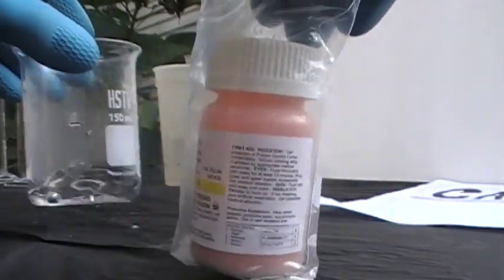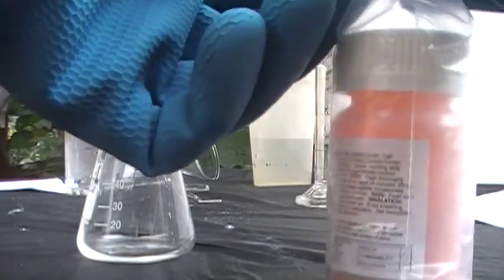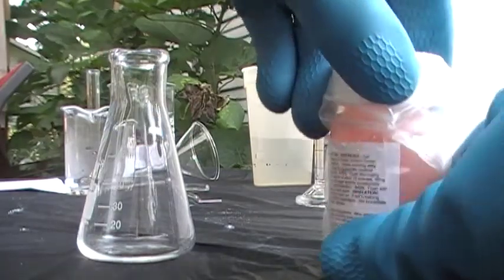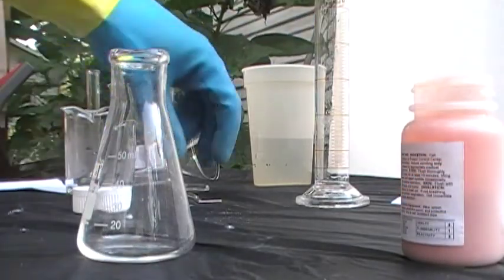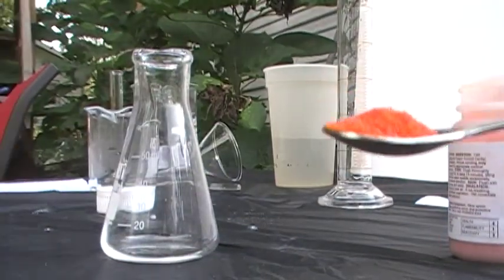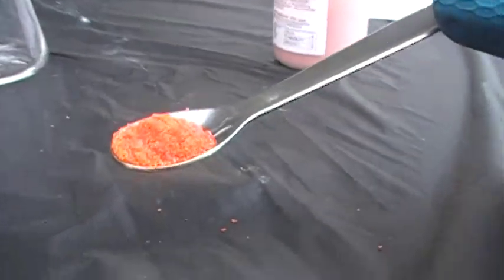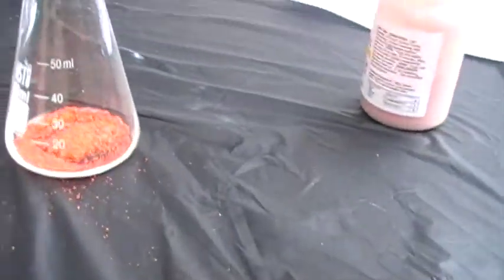So then you're going to get your ammonium dichromate. There is no exact measurement I've found for mixing these things — pretty much just a scoop of this and a splash of that. It's a really nice orange color; I really like this. It's way more orange in real life than on the camera — it's almost red.